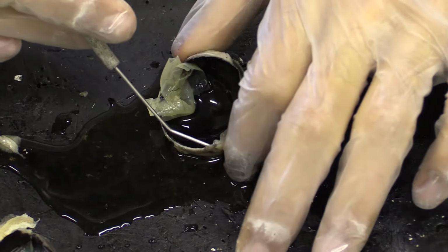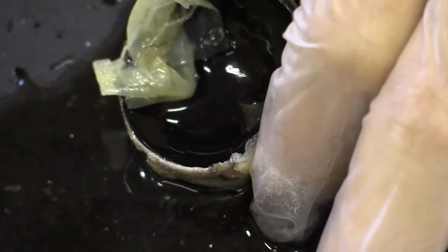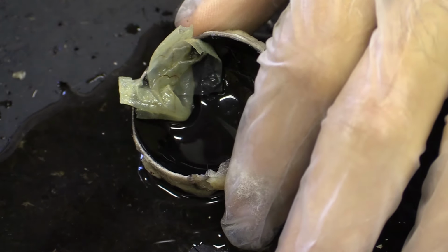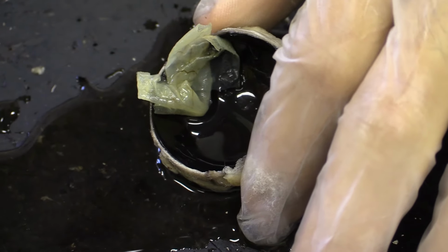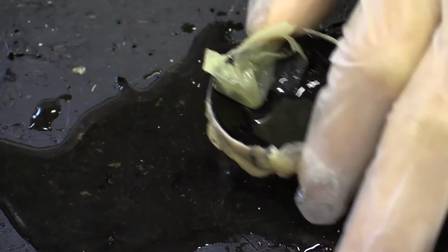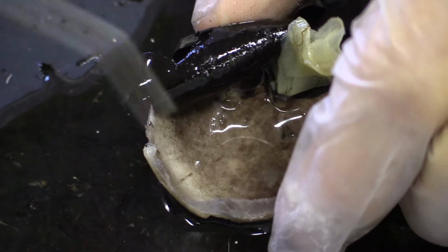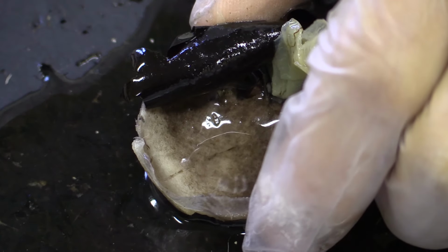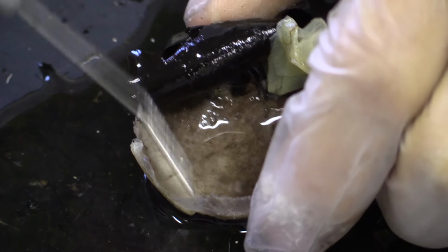But then, what's this black layer? This black layer is actually called the choroid, and it's extremely vascular rich. There's a lot of blood vessels which directly supply the retina. If we pull back the choroid, we have the sclera, which has been slightly dyed by the black pigment within the choroid, but this is the sclera.